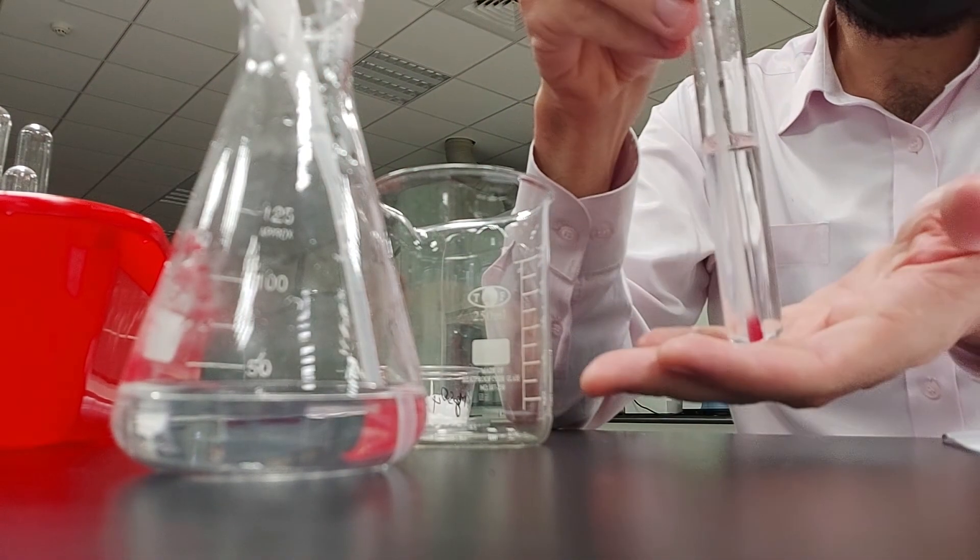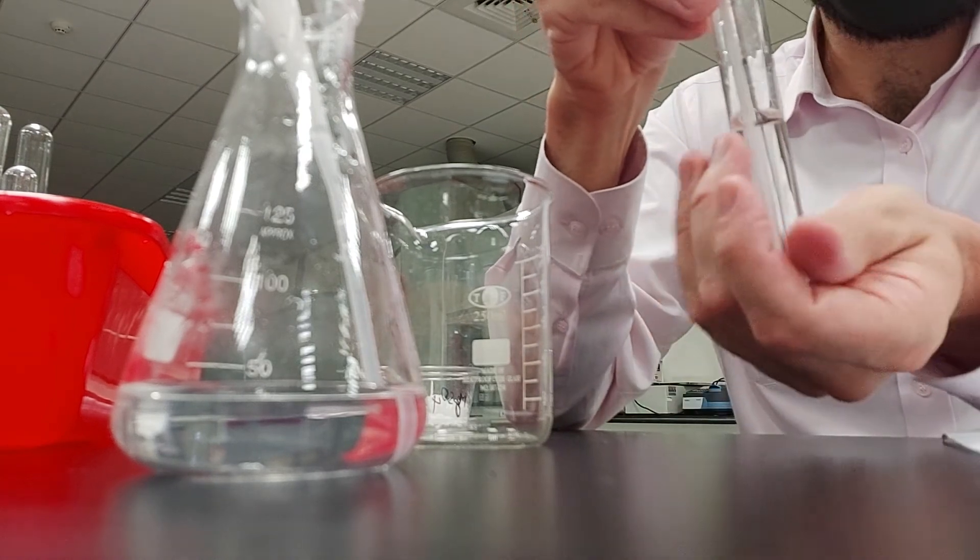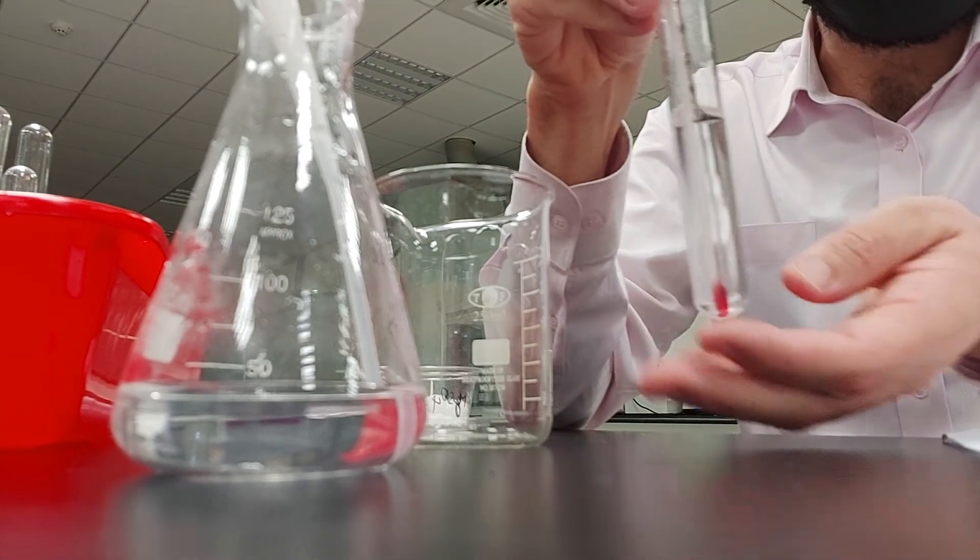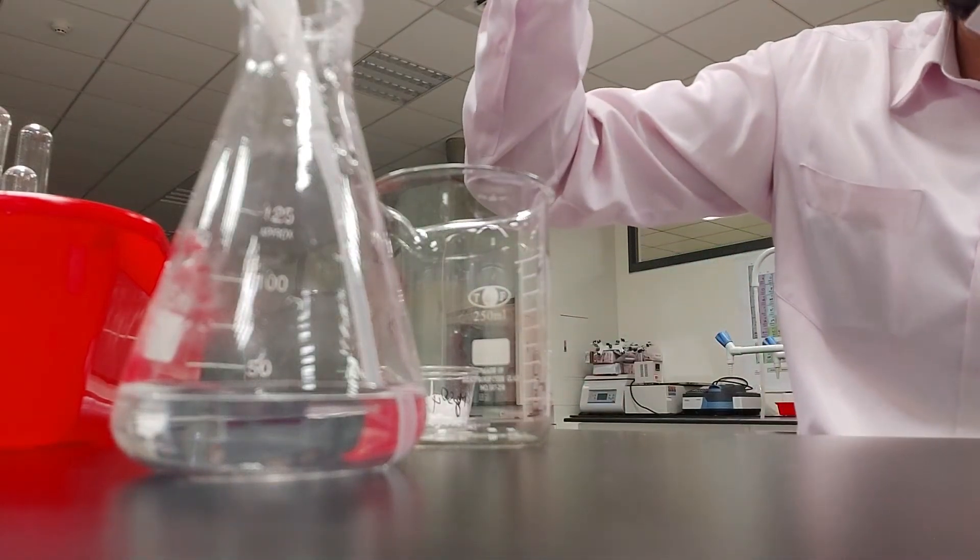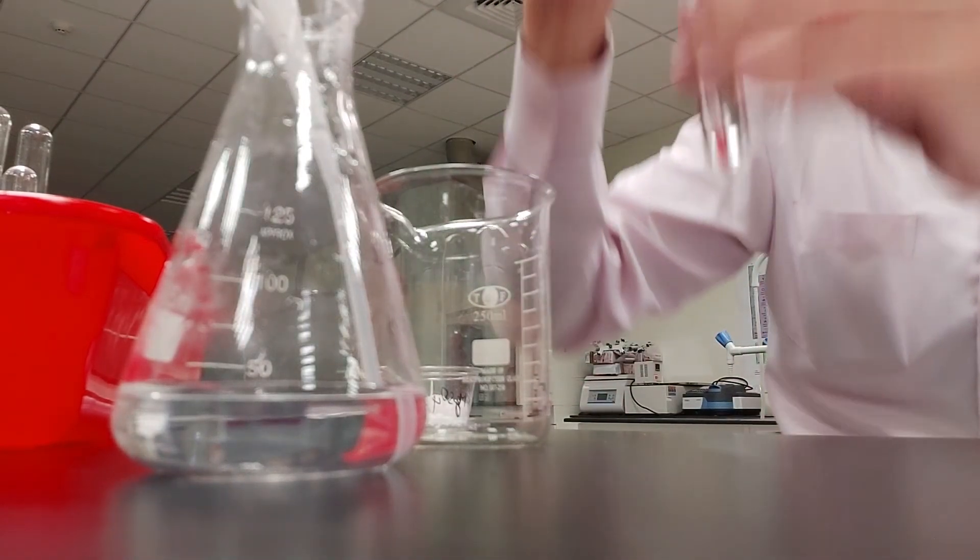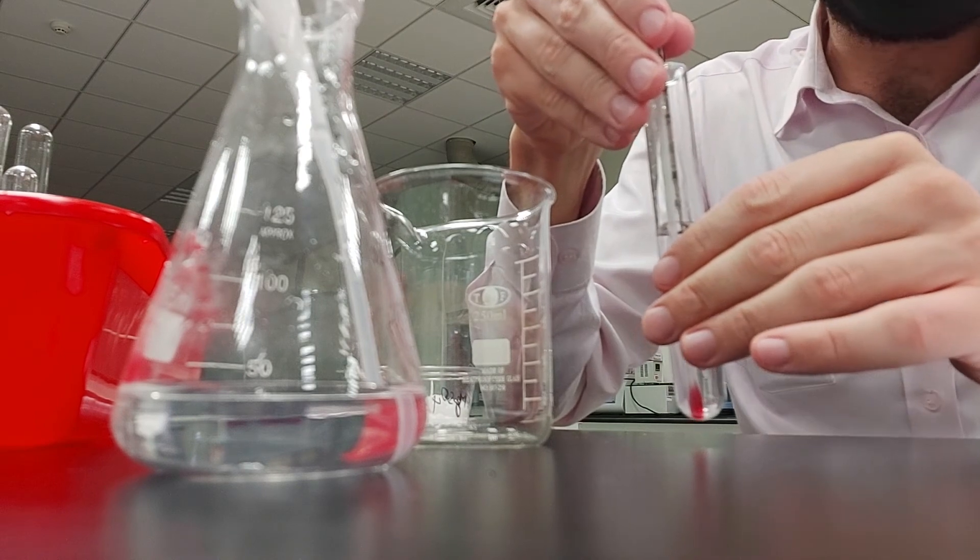Okay, now when I feel the bottom of the test tube here, you can actually feel that it's getting cold. Okay, so the temperature now is 24.0 degrees Celsius.